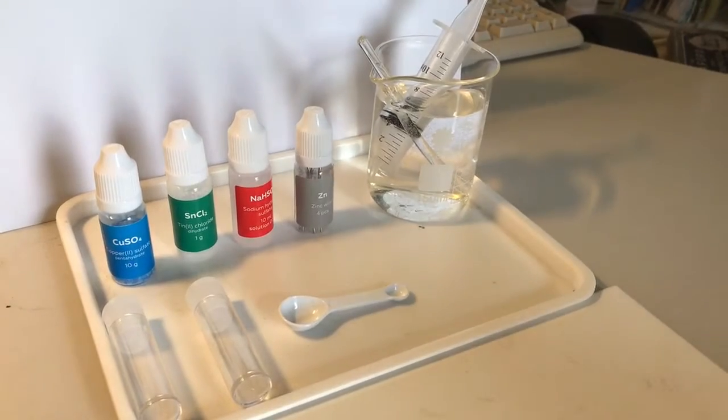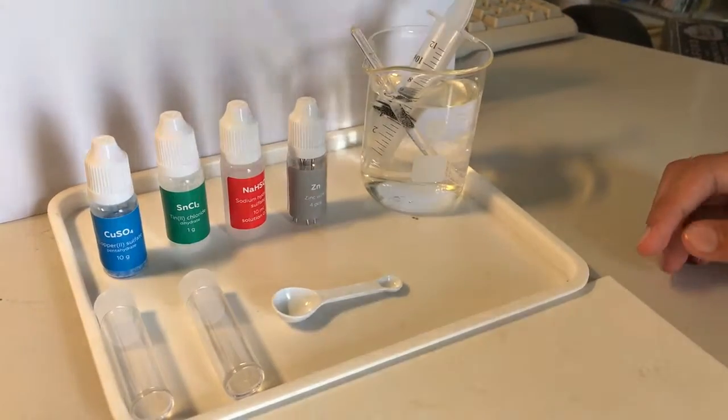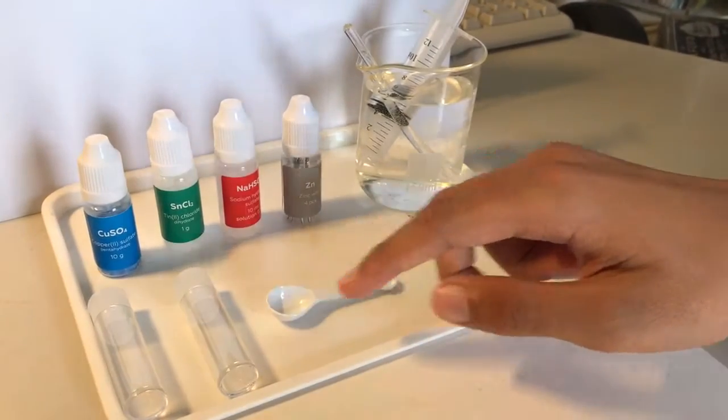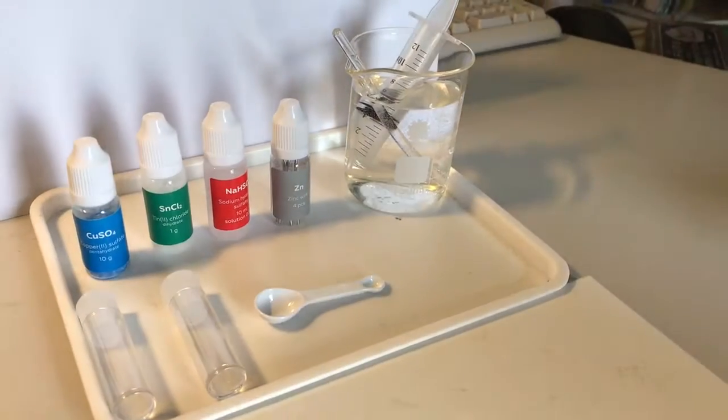We will also need some water as well as two vials or test tubes, a graduated syringe, and a measuring spoon.